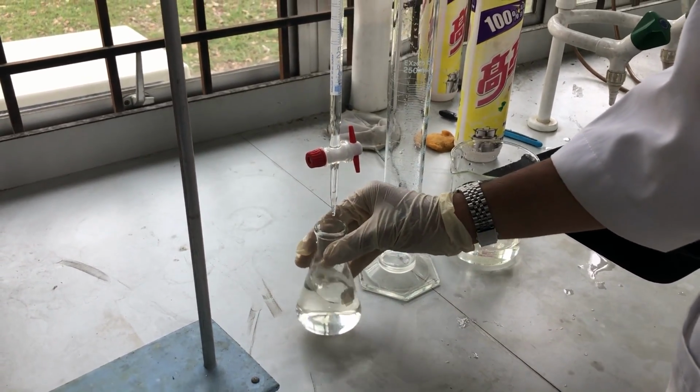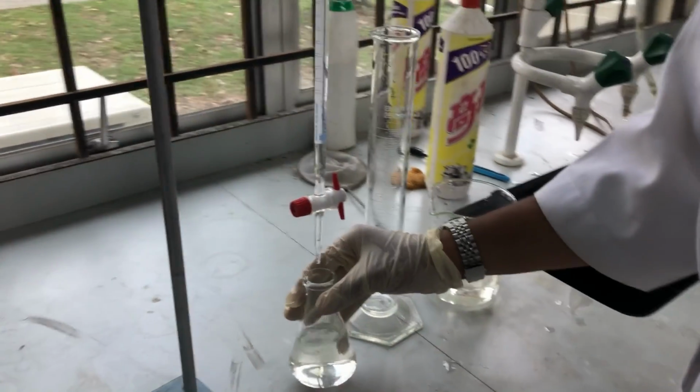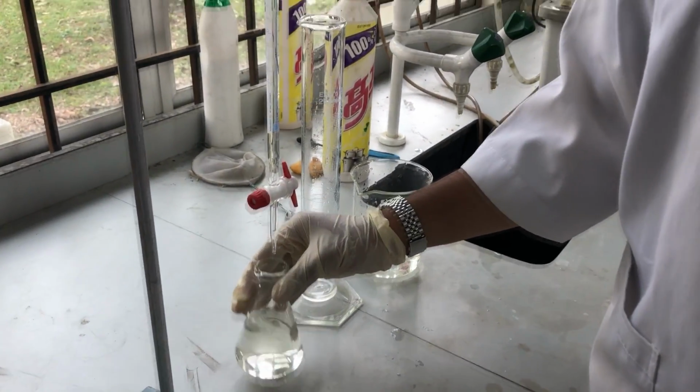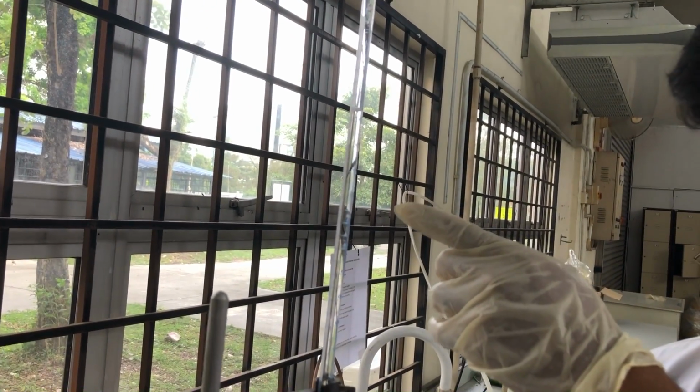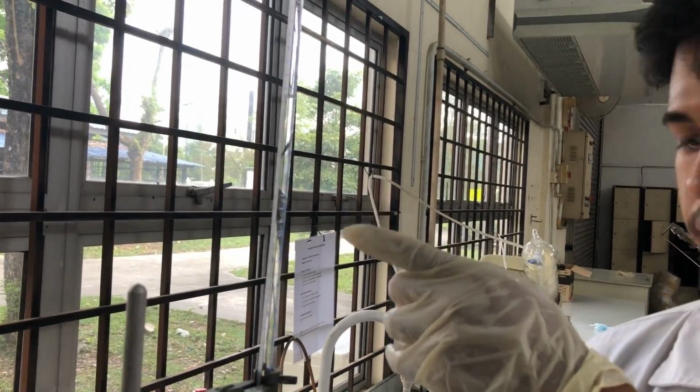Right. While the water drips, stir it gently until the solution turns pink. So the phenolphthalein is the indicator that we use to detect the carbon dioxide in the water. So we need to wait until the titration process makes the sample turn pink, and then we can measure the carbon dioxide content in the water sample based on the sodium hydroxide that we used while we were titrating the sample.